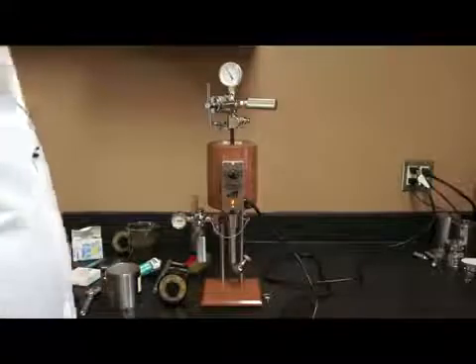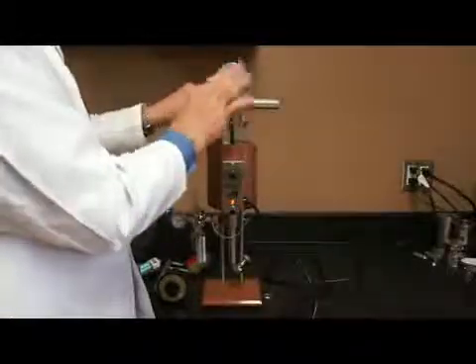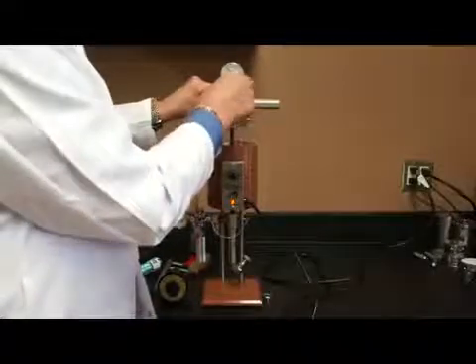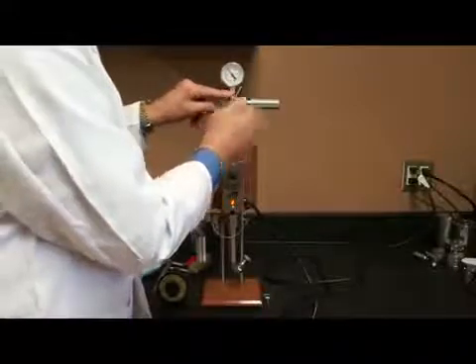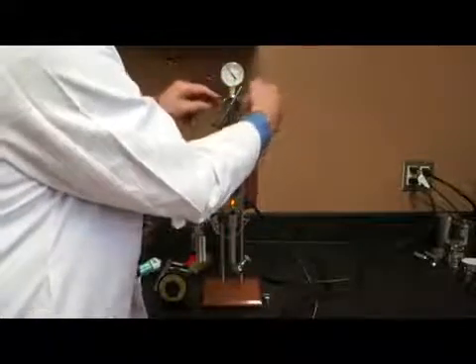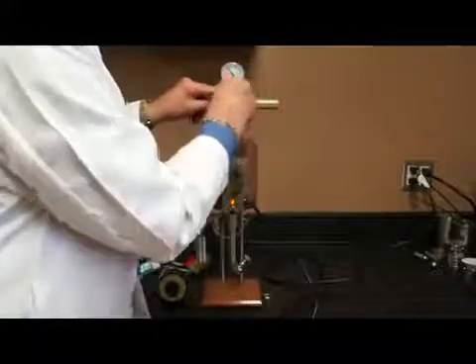So the next thing I do is I want to stop pressure from going into the regulator assembly. I close off the flow of the gas, if you will. So I do that by loosening the T-screw. And when I do that, I'm depressing the pressure on the diaphragm. And the diaphragm is popping back into place. And when this gets loose, as it is here, there is no pressure coming from the CO2 bulb through the regulator. It's being stopped by the diaphragm.